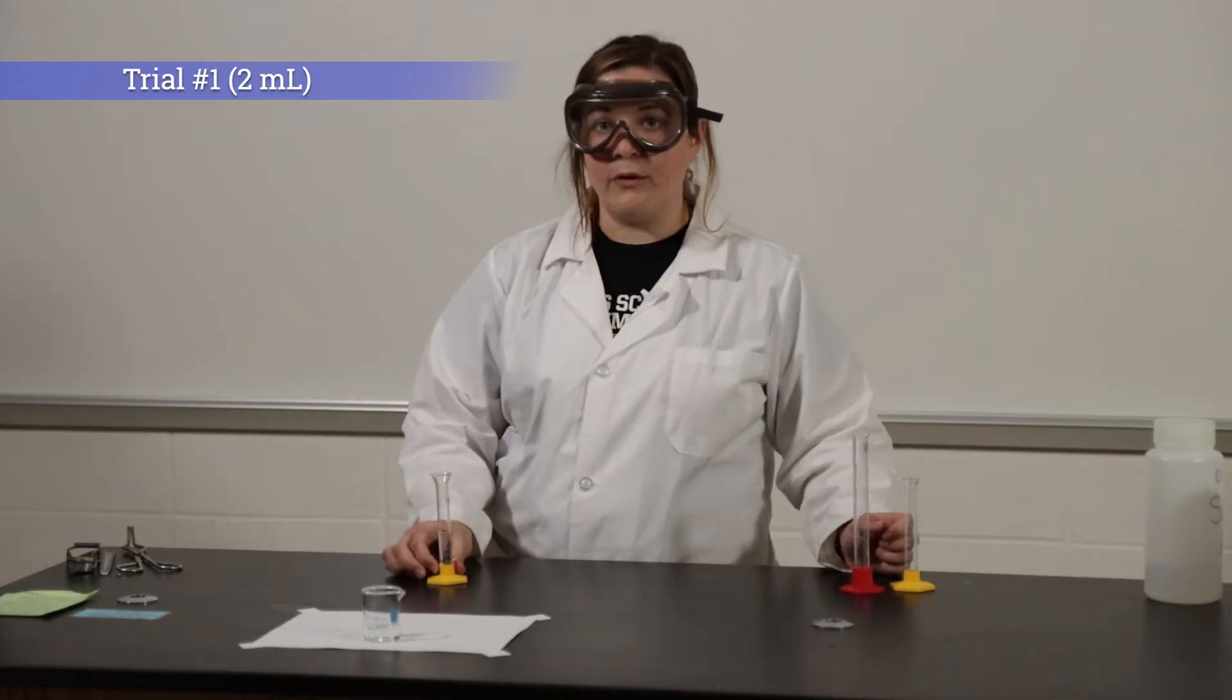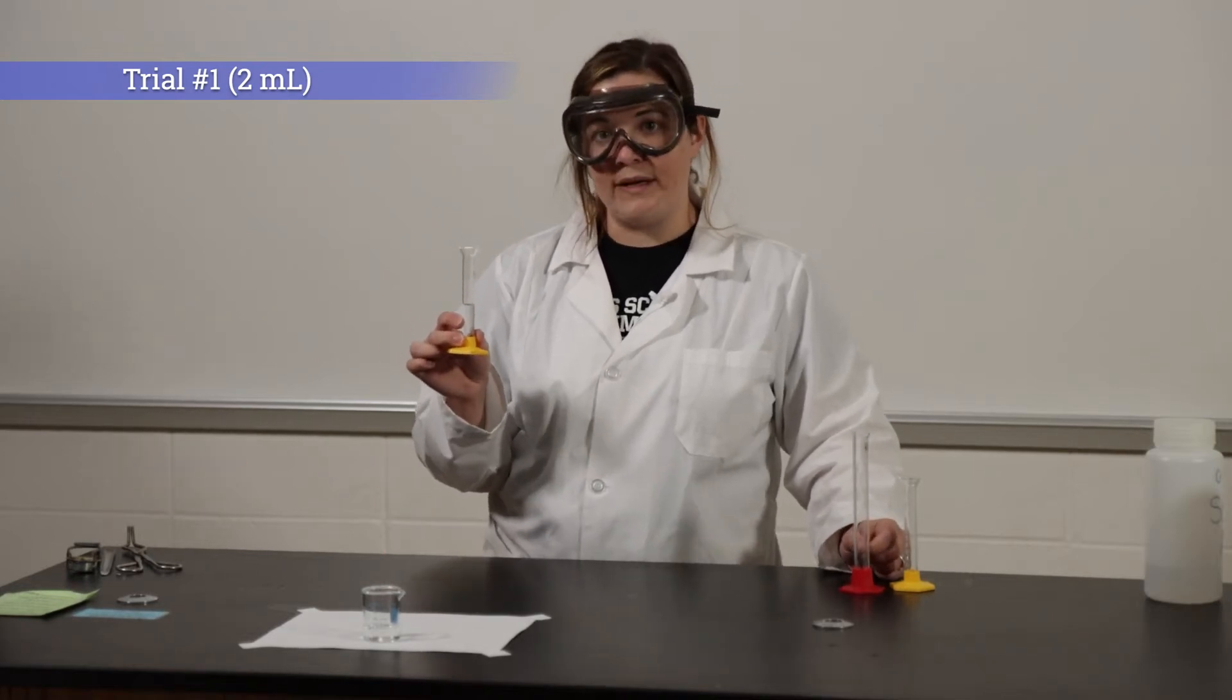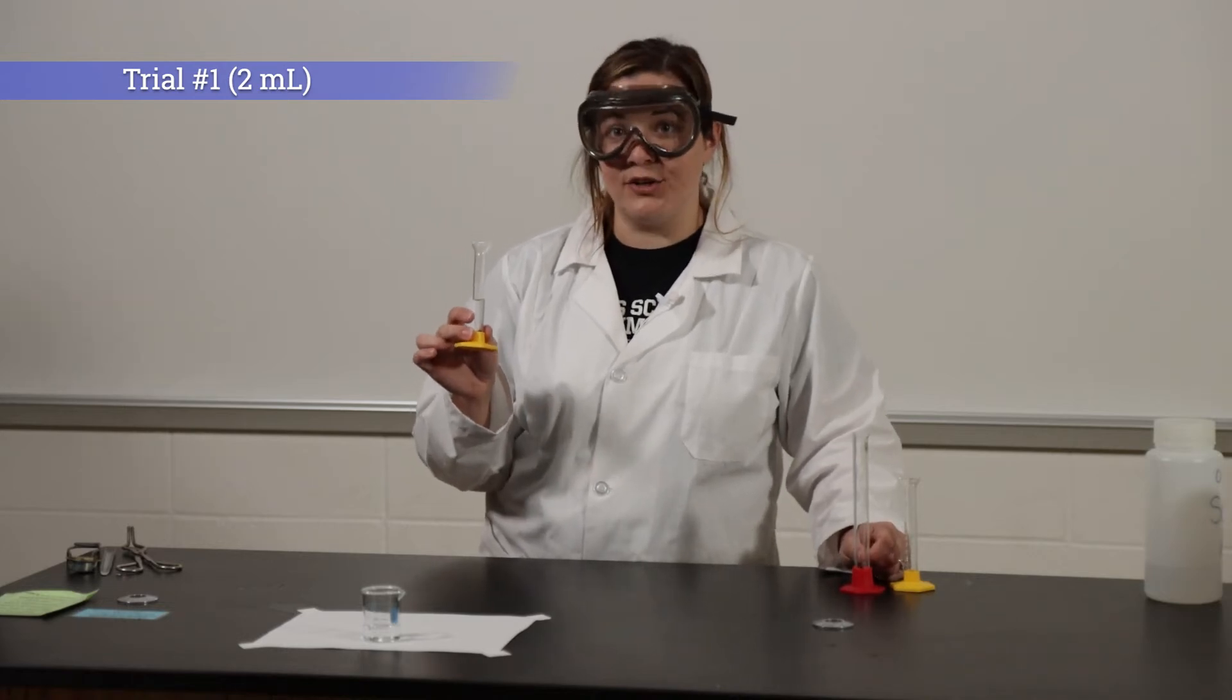So now what we're going to do is add solution B to the beaker and we are going to record the time that it takes for our solution to turn dark blue.